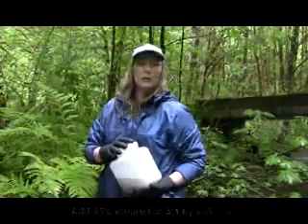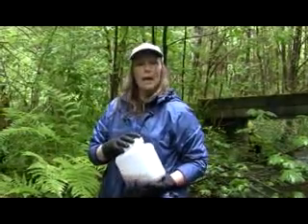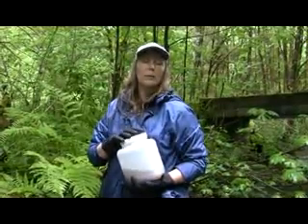We've just collected our first sample out of 8, so you're going to continue up the transect, and you're going to put all the rest of your samples into the same jar. So your ethanol will be mixed in at the end of your work.